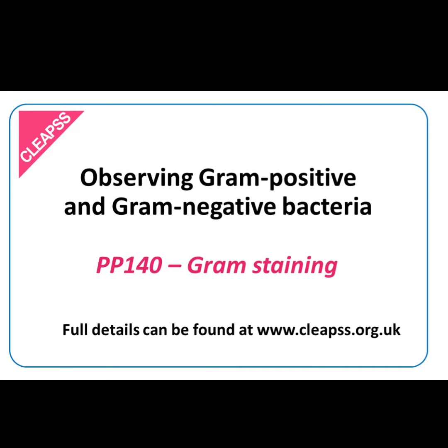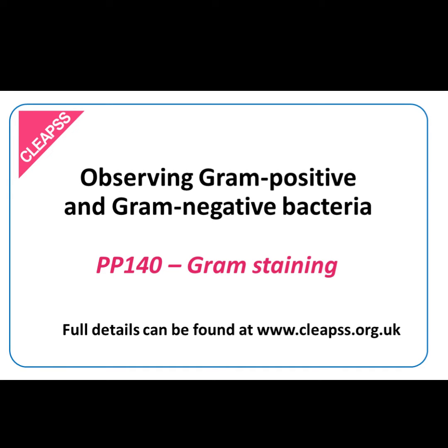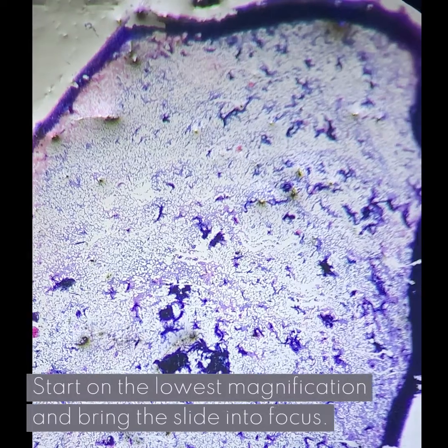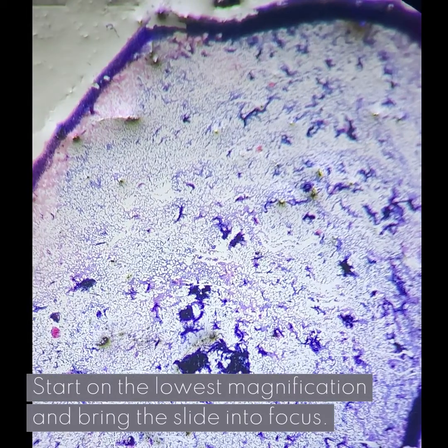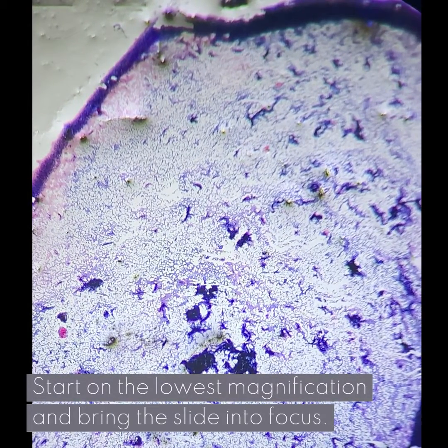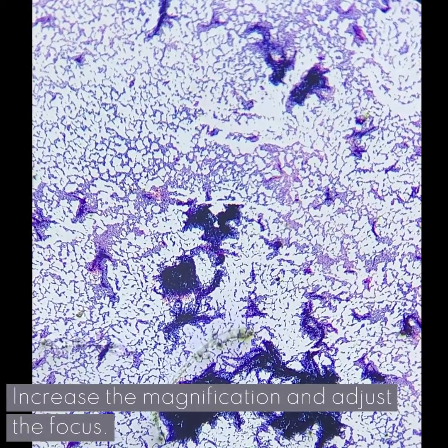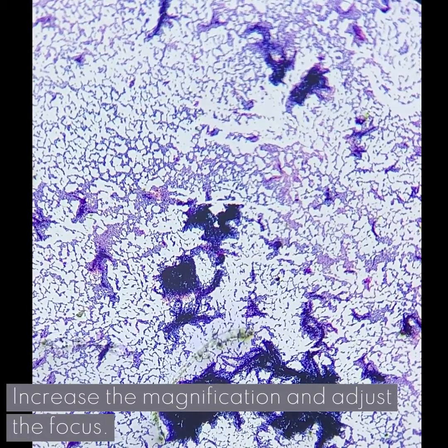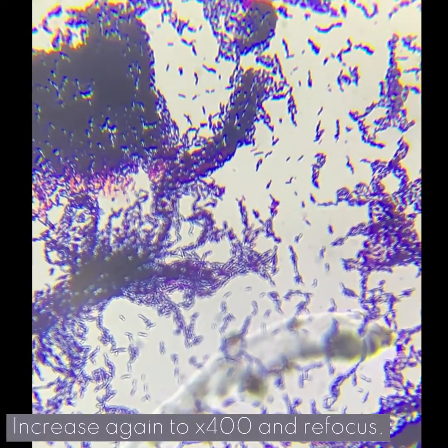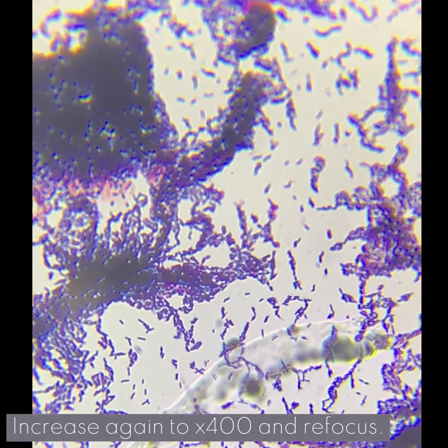Observing gram-positive and gram-negative bacteria. Start on the lowest magnification and bring the slide into focus. Increase the magnification and adjust the focus. Increase again to times 400 and refocus.